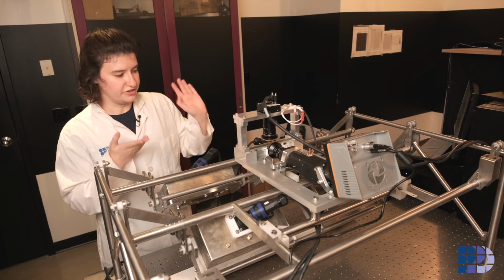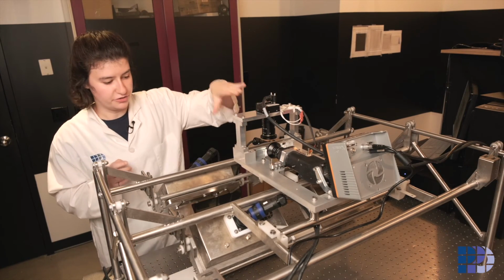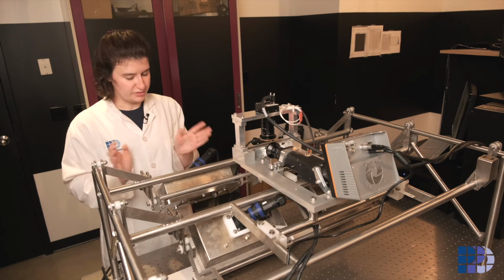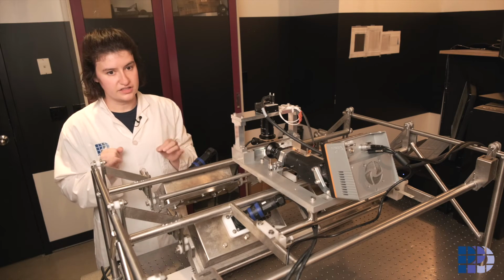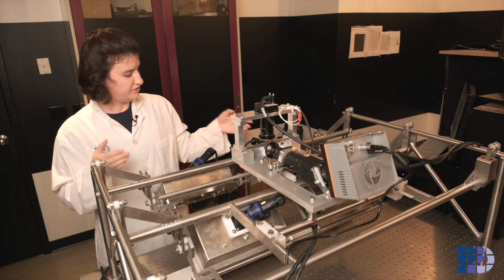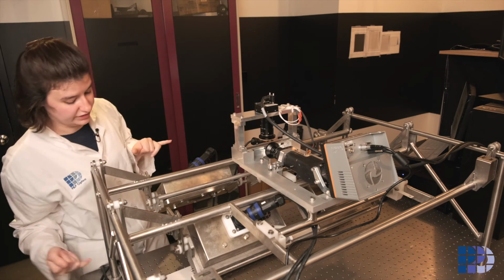Priya has assembled our spectrometer and aligned both the visible camera and the spectrometer on our frame. And now that I've assembled all the lamps and the bulbs in each of the lamps, the next step is to put the lamps on the frame, which you can see here. There's 4 lamps, 2 on either side of our scan line.